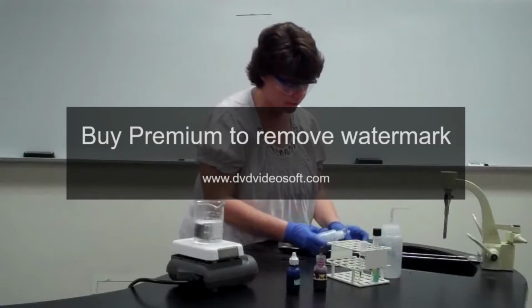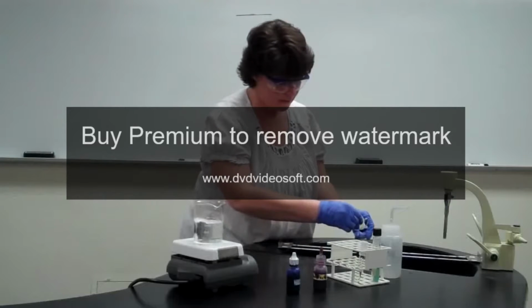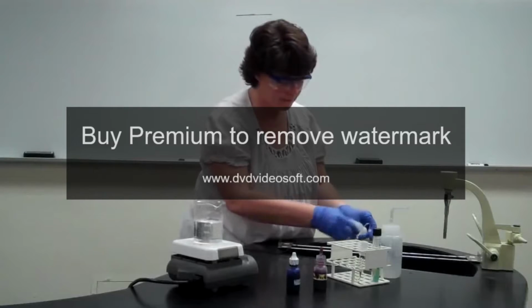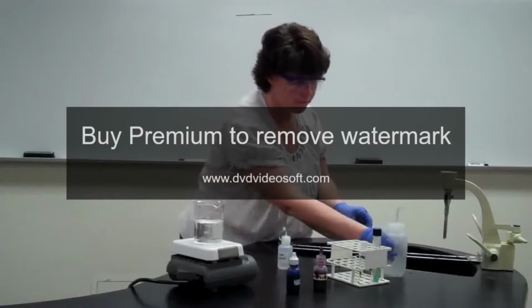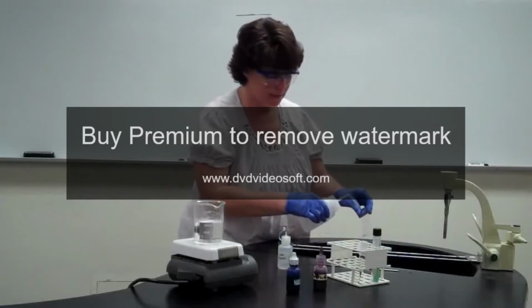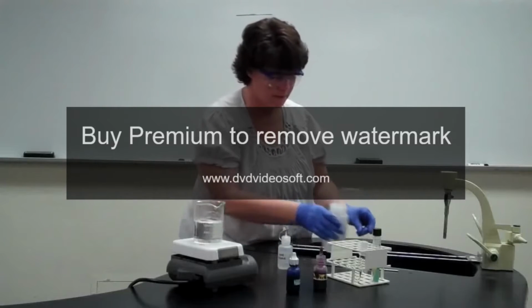And so we're going to do just like we did with the gram stain. We're going to just drip on there until the stain runs almost clear. Not clear, but where it's a very light pink. Okay? Just as we did before, we want to stop that process right away. So we're going to rinse it immediately. And once again, we're not drying between any steps.